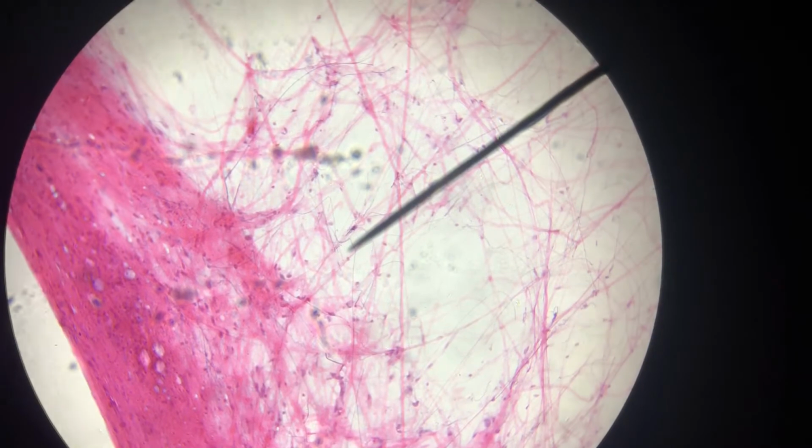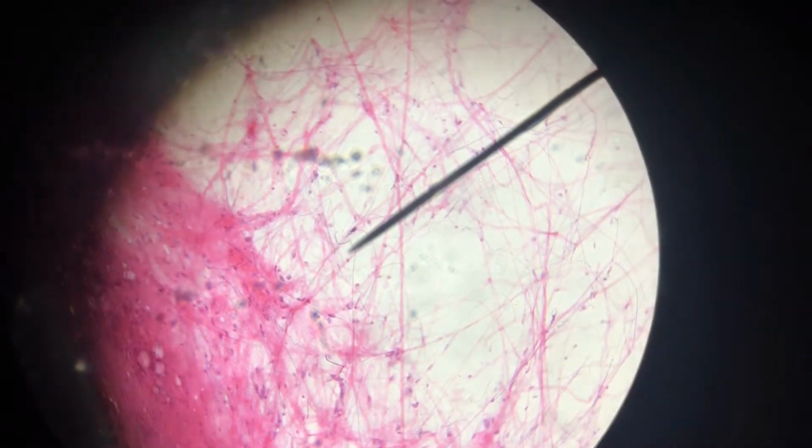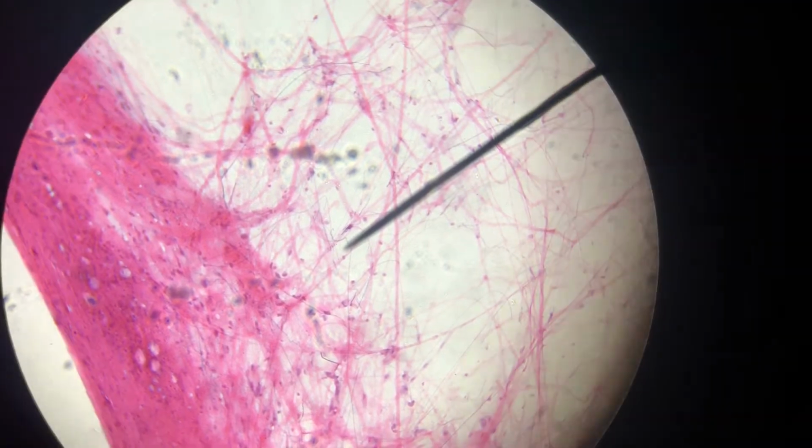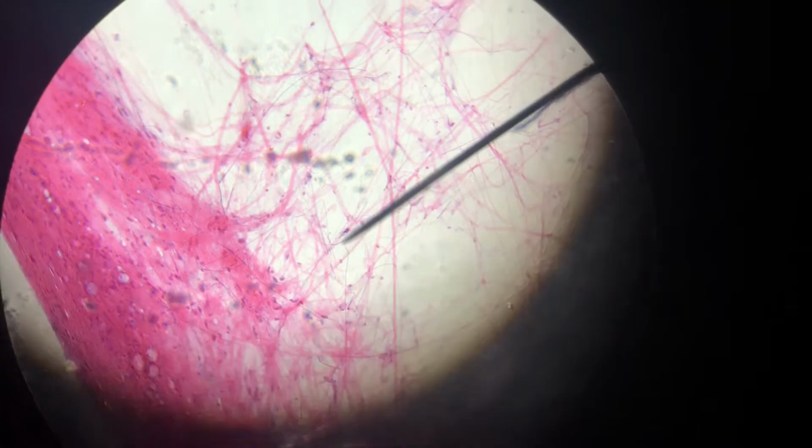Okay, people, it's like I said yesterday, there's no fancy introduction. It's connective tissues. You only have 3 to look at, so I'm actually going to have you look at nervous tissue too, just because it's cool. You're not going to be tested on it, but you should look at it.